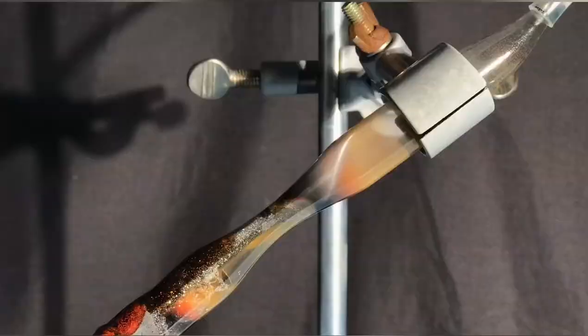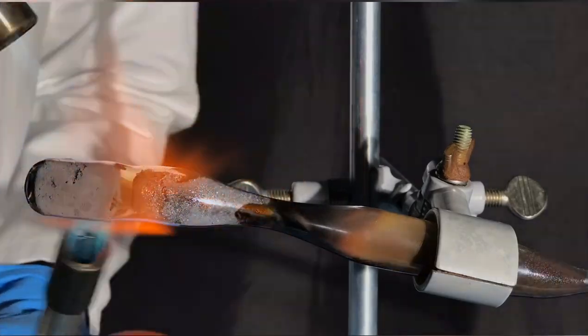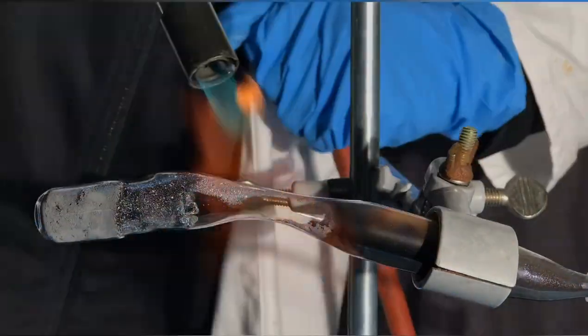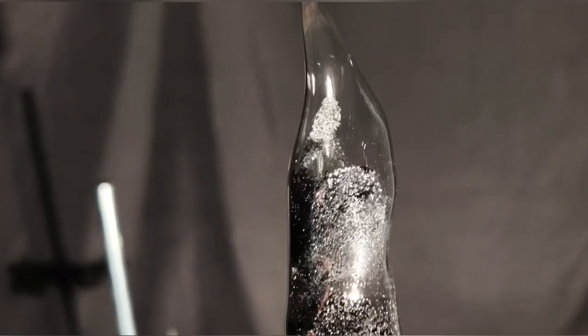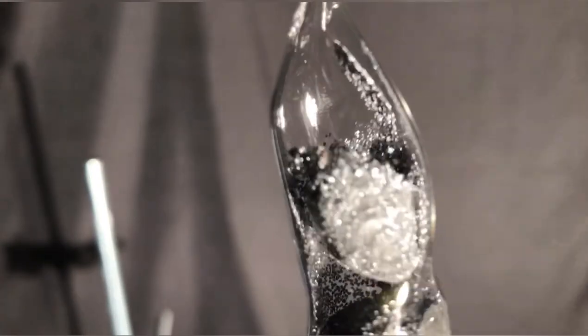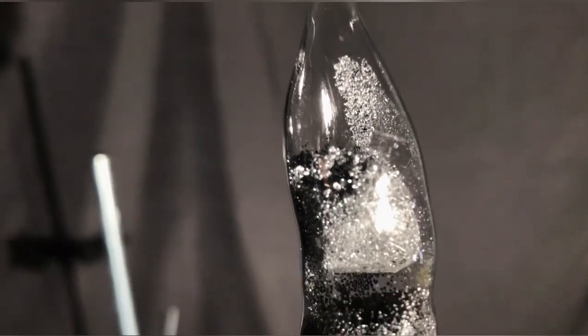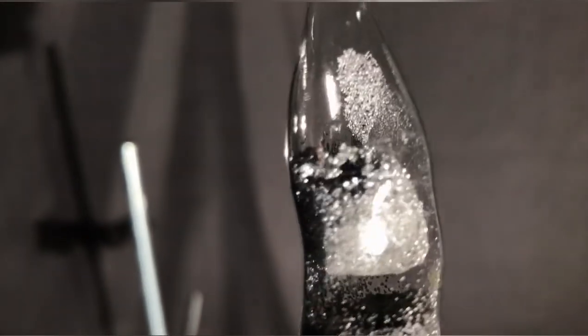Using one or two or a big Bunsen burner we achieved the temperatures necessary to sublime the arsenic. You can see these huge, really pretty looking chunks of arsenic resubliming on the walls of the test tube. It seems like we did a great job at sealing the ampoule with a somehow inert gas. Vacuum would have been better, but hey, we made some shiny arsenic. Nothing to worry about.